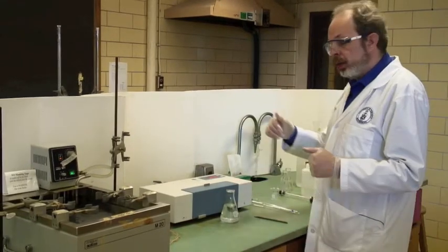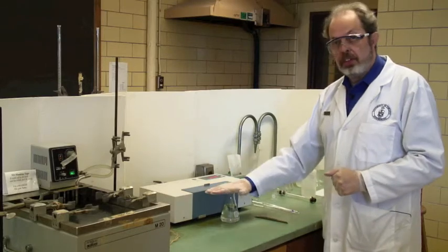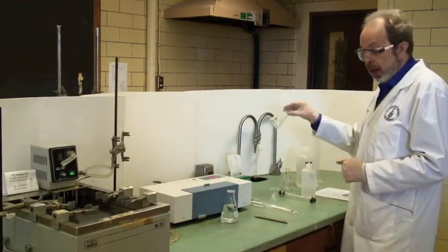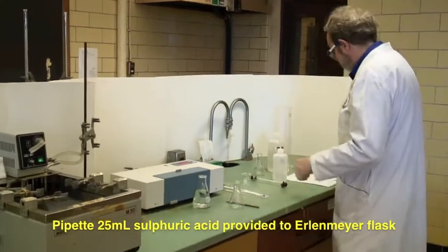For any one reaction we're going to want 25 mils of the syrup solution and 25 mils of one molar sulfuric acid. So let's measure out the sulfuric acid first.